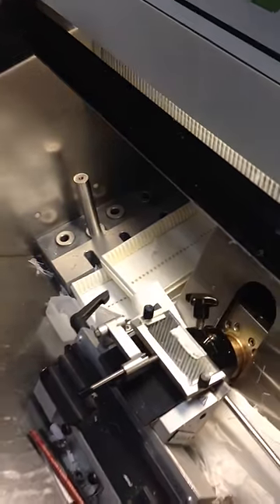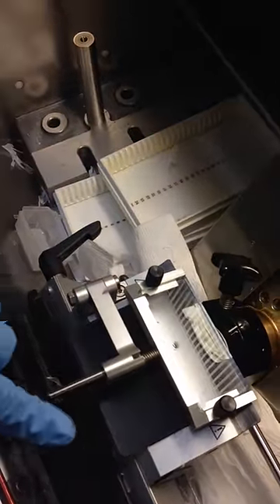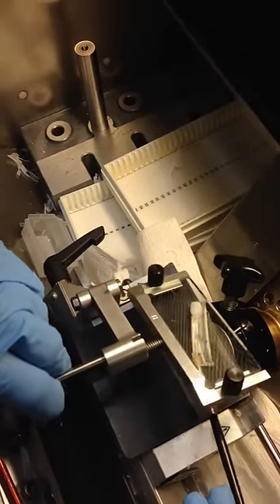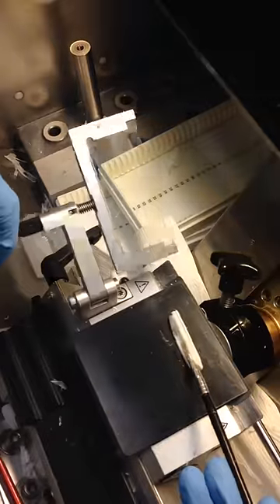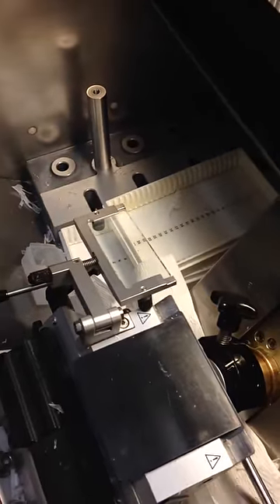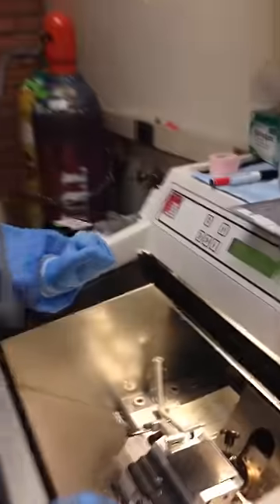Alright, so now I am going to try to make this one work. Maybe this one will not really work well — the next one will definitely be much better. But you get the main principle.